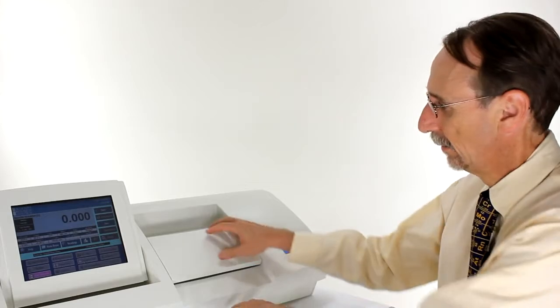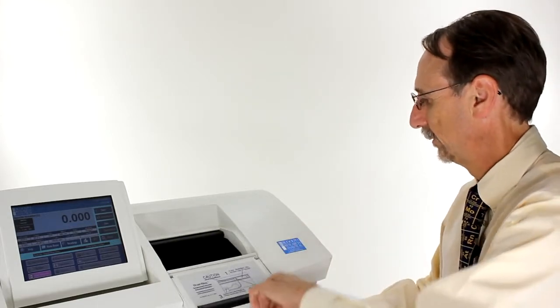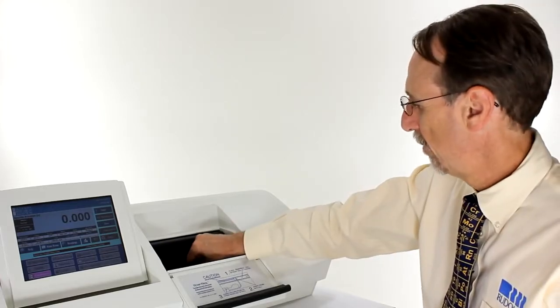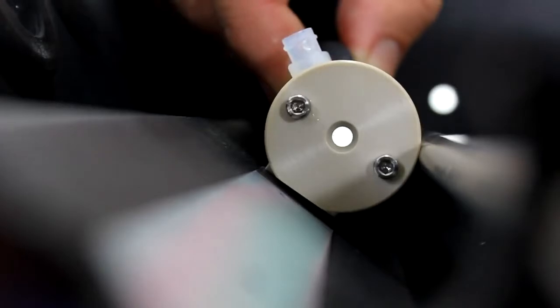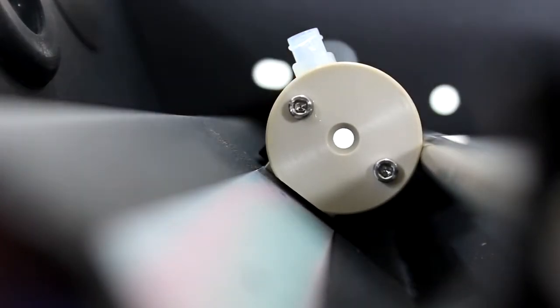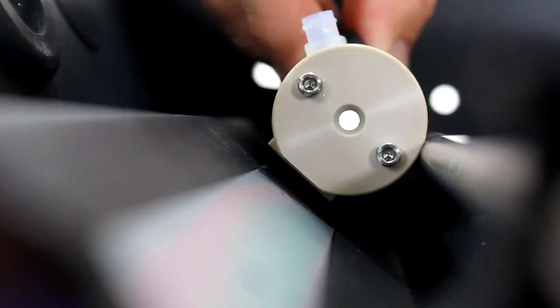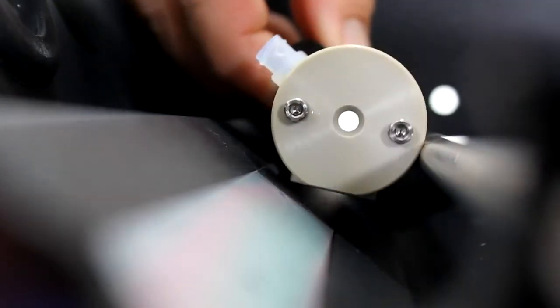Now that I've filled the cell I'll place it inside the instrument. I'll place it in the trough and move it to the right hand side. When placing the cell inside the trough ensure that the back part of the cell mates correctly with the Temptrol section at the back of the trough. This is important because this is the section where the heat is transferred across. Ensure that the cell is not canted like so or like so.